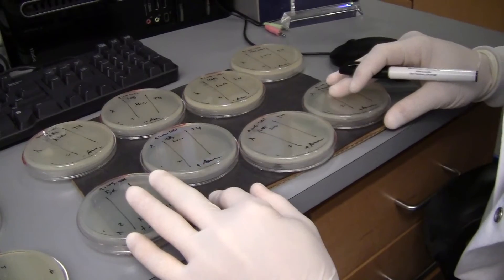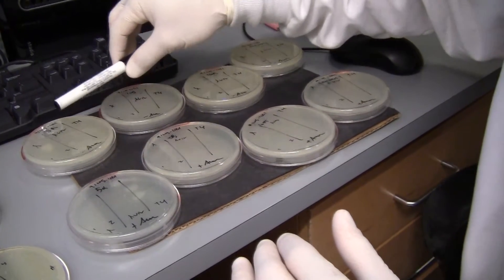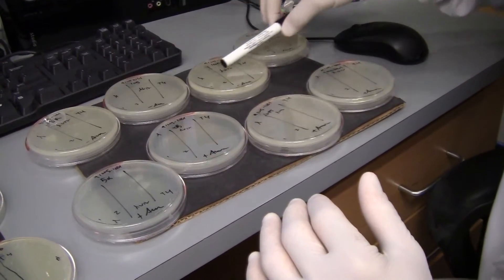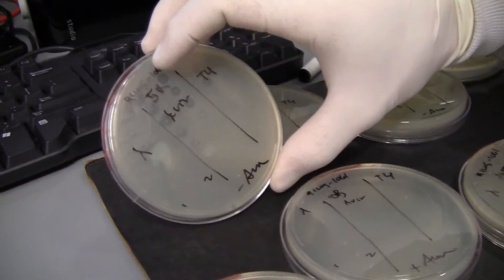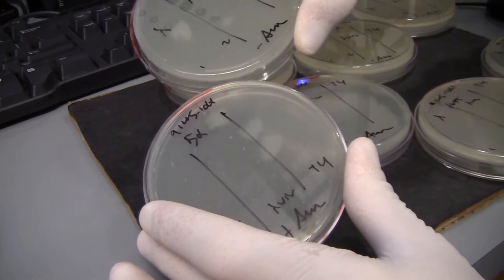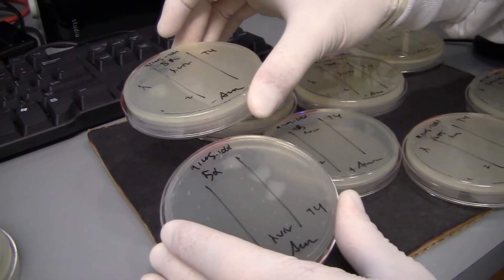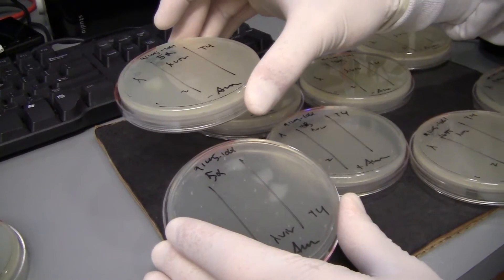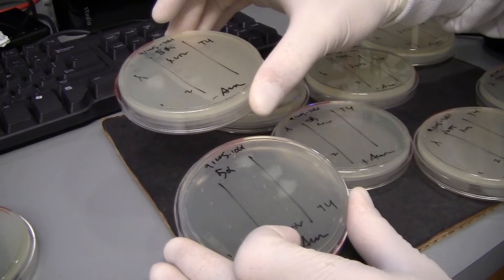A couple things to note: we have the uninduced T4 top plate here with all our different strains, with P-Bad driving the T4M gene. When P-Bad is not induced, the plate looks okay — it's kind of cloudy, you can see definite spots which are phage plaques. But the induced condition doesn't look nearly as healthy; you can actually see individual colonies. My first instinct is that I over-induced and got some toxicity, so my cells didn't grow up, which means I didn't get a thick enough lawn of bacteria for the bacteriophages to lyse.